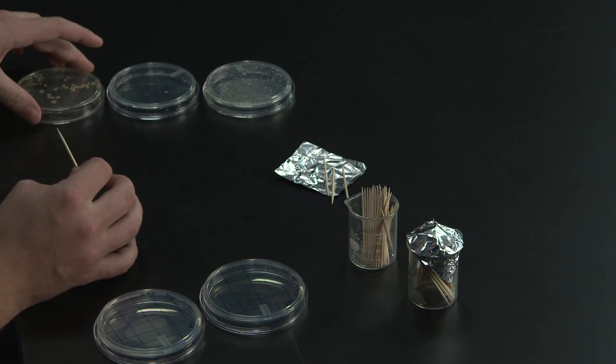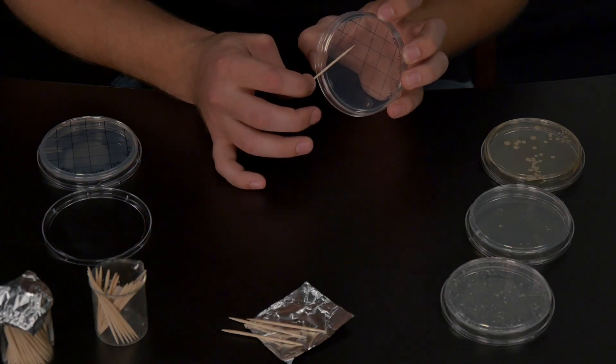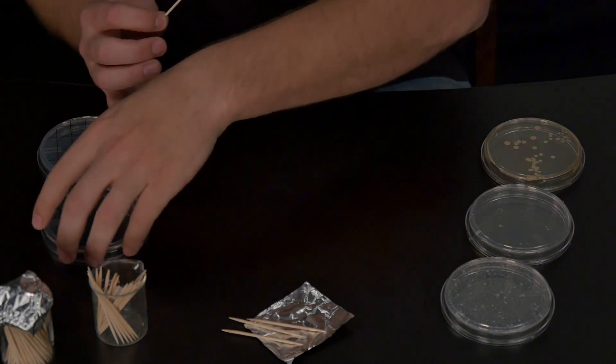If you are transferring to two or more plates, you can simply continue using the same toothpick. Just be careful not to touch the tip or set the toothpick down in between plates.